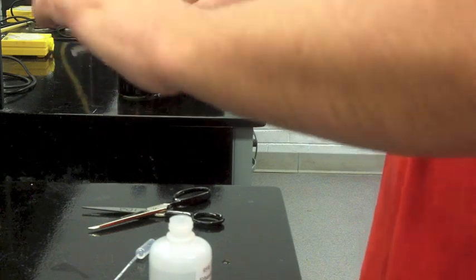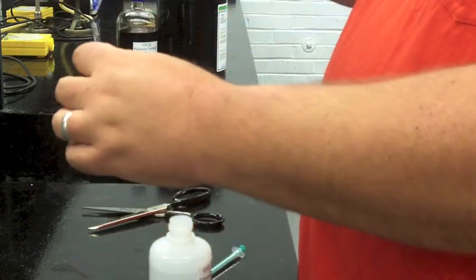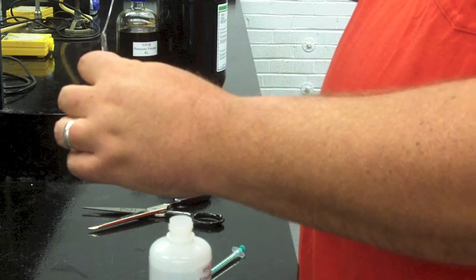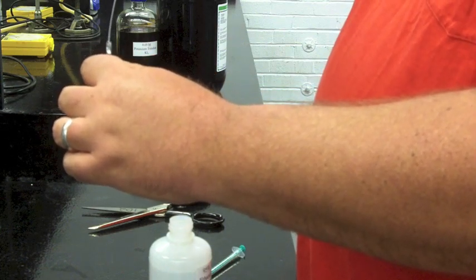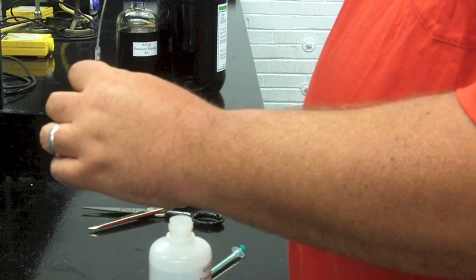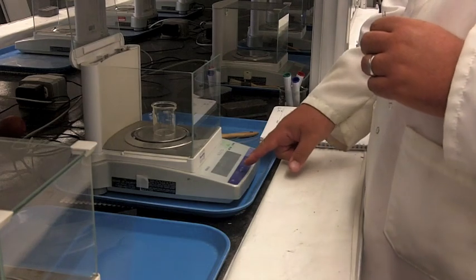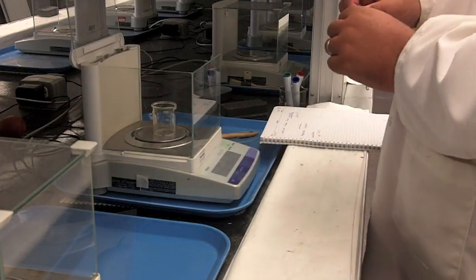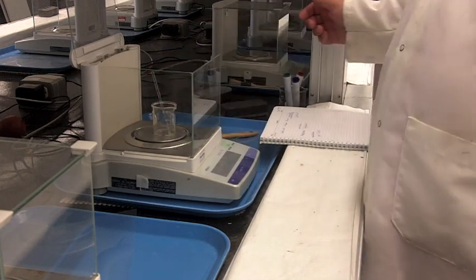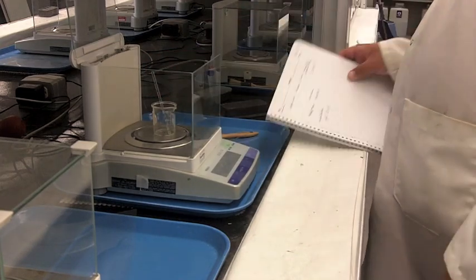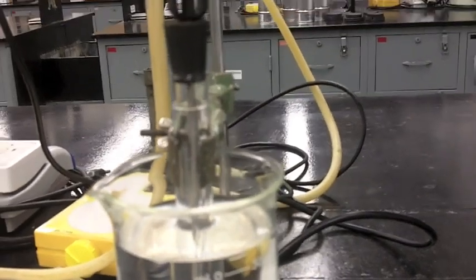Then I will come by with my syringe and add the 200 microliters of air. Now it's going to be trapped, but you want to make sure that bubble doesn't all of a sudden pop up. You do need to top it off with some liquid. There will be a little bit of liquid at the top that I displaced that's not in the bubble. So you just top that off with a little bit of liquid, and then we're going to mass that one more time. For most of these solvents, they have enough surface tension that we should be able to keep it upright and the bubble stays trapped, but you want to be a little careful there.